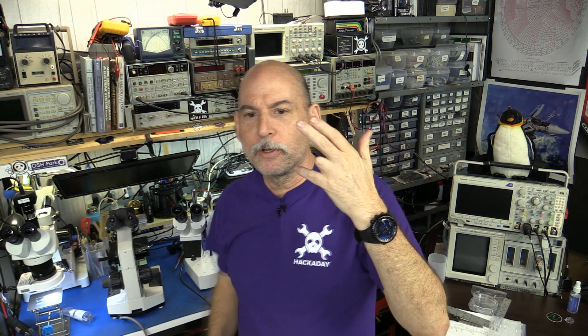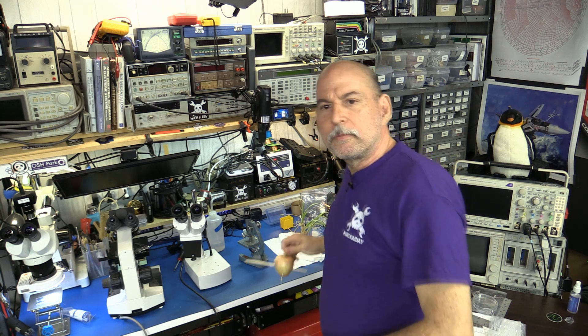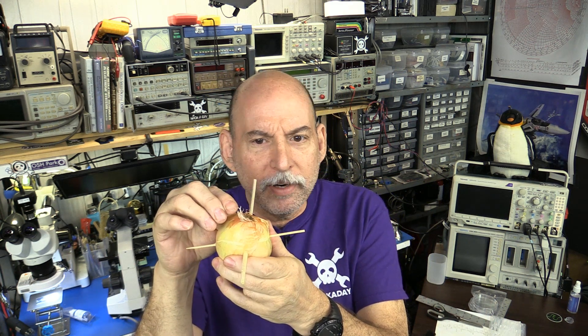What is mitosis? Mitosis is the splitting of cells. It's probably one of the most famous shots you have of seeing the chromosomes kind of come together and then coalesce and then split apart. The place where we're going to find mitosis happening is these onions sitting in water — the very tip of the roots is growing so fast that we should be able to see the cells splitting. So that's what we're going to do today.